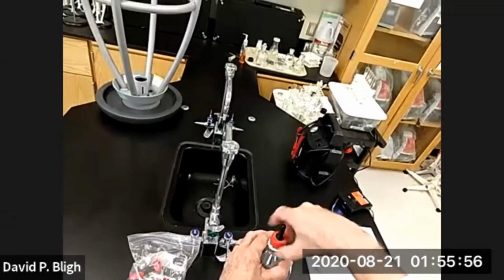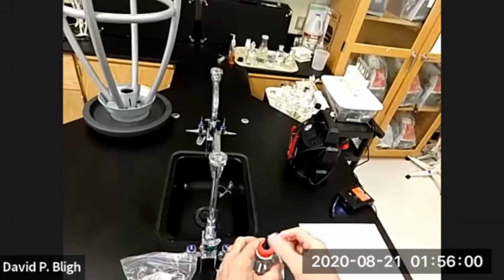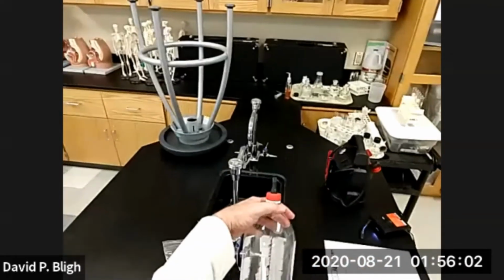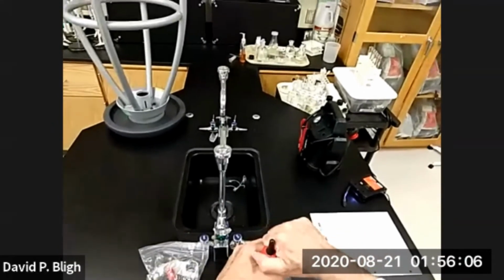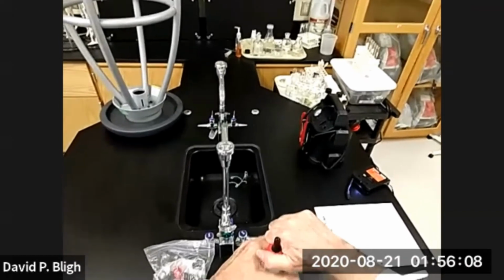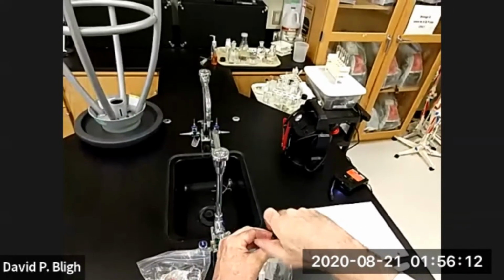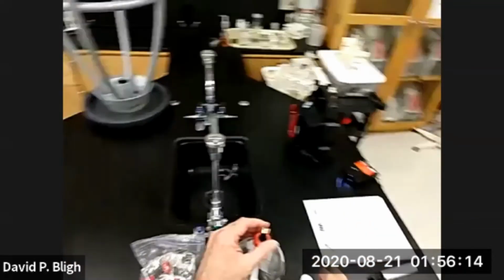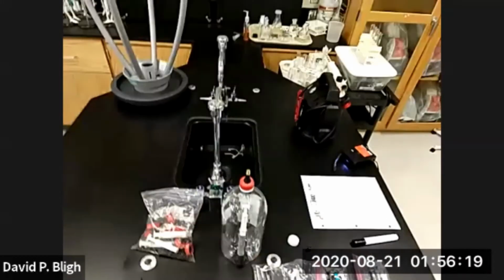So I've created these little valve caps. And this valve stem ought to look familiar. It's the same one that's on many people's tires and their wheels. Okay, sealed up. Now we can add air to the surroundings and increase the pressure on the inside.